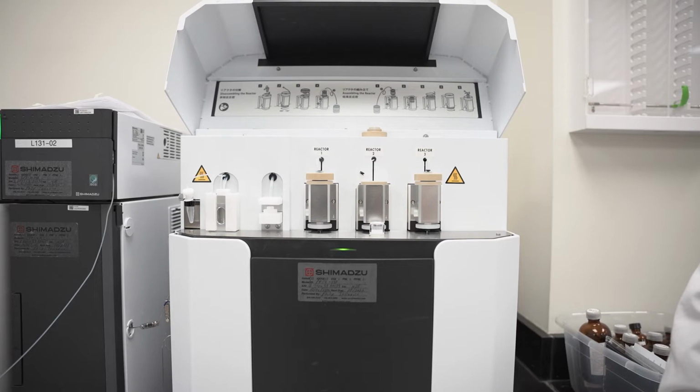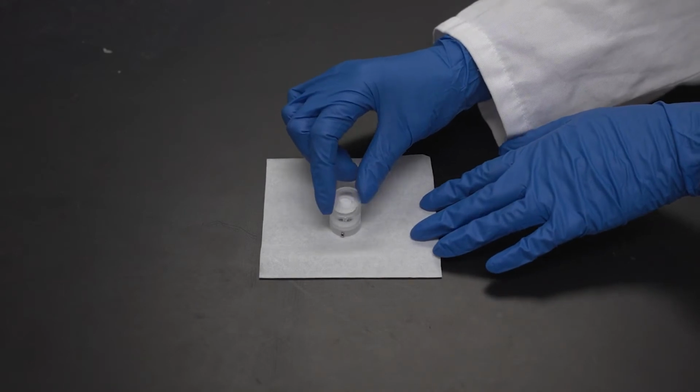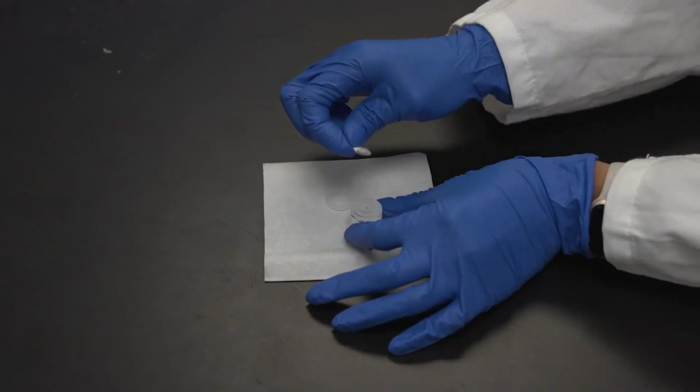Once you have removed the upper reactor chamber and spacer, flip the chamber so that it is resting stably and upside down on the spacer. You will then see a filter holder. This may contain PTFE filters and a membrane if the reactor was used previously. Remove the filter holder and dispose of the used PTFE filter papers and membrane.